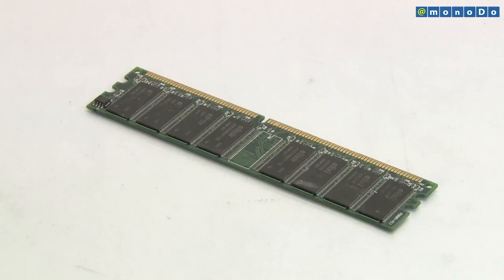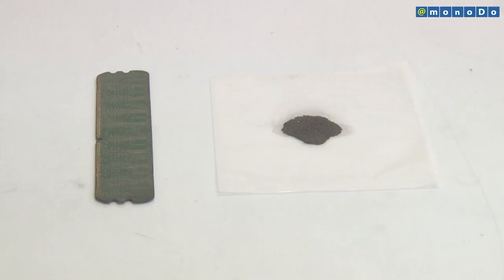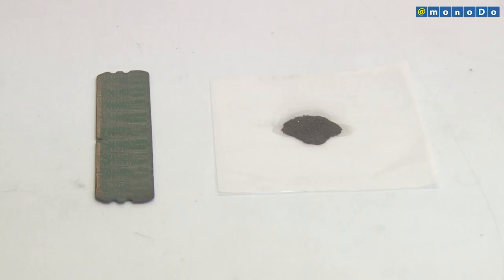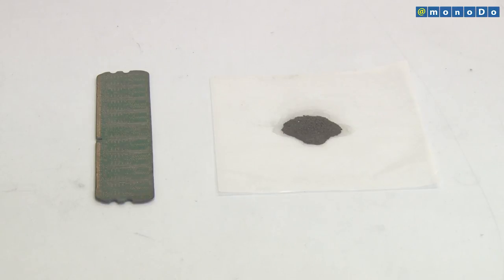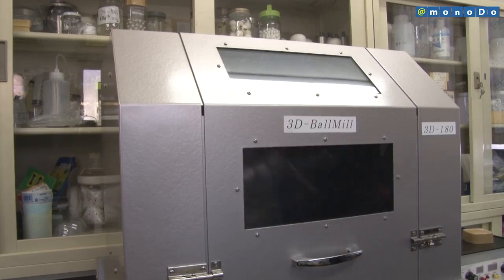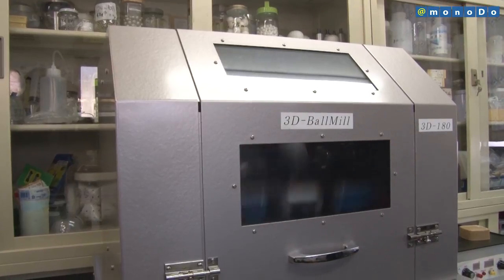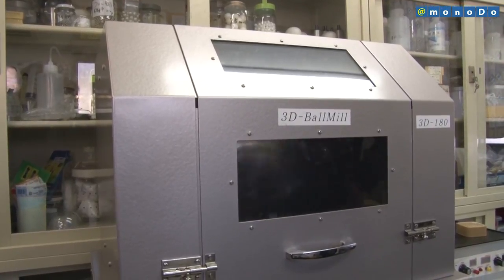Nagao Systems proposes the use of its 3D motion technology for what are known as urban mines, to utilize large volumes of material discarded as trash, and for methods to remove radioactive material including caesium.